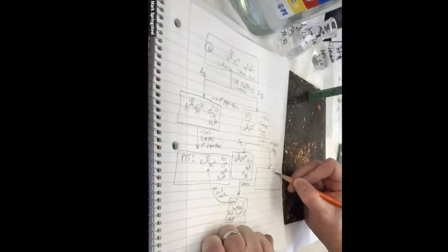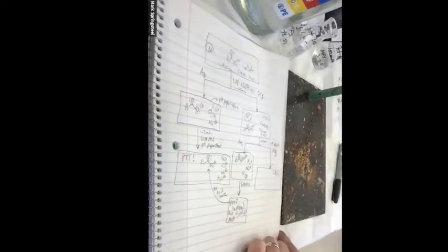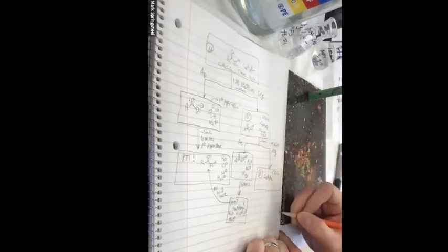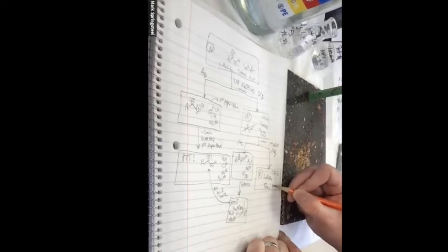Methylene chloride. And what else is in here? Got your neutral molecule, your dibromobenzene. What's the other one? Got your trace water. Yep, that's it.